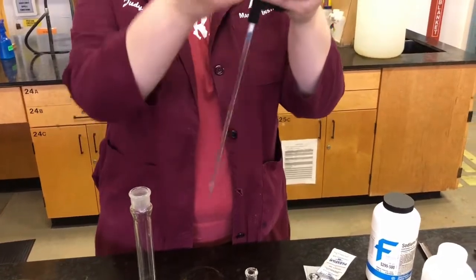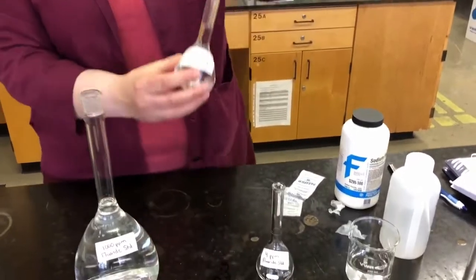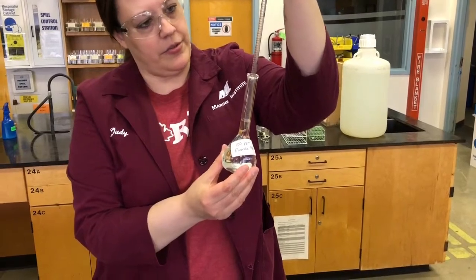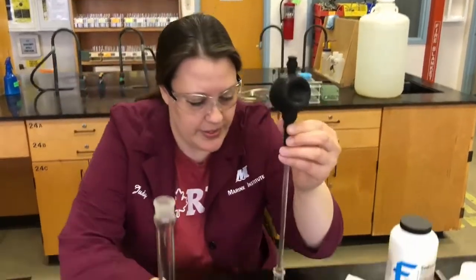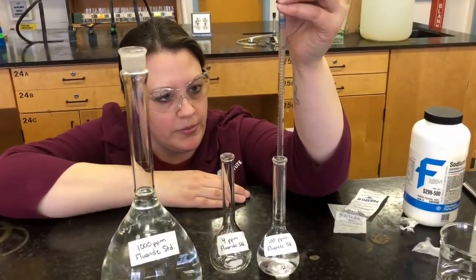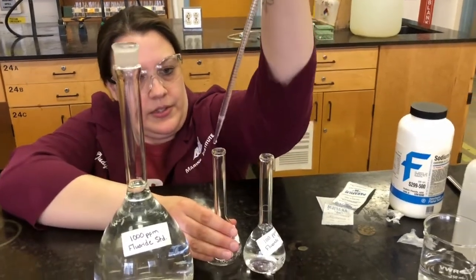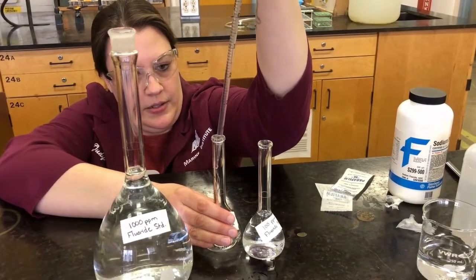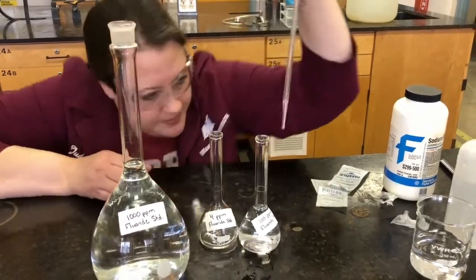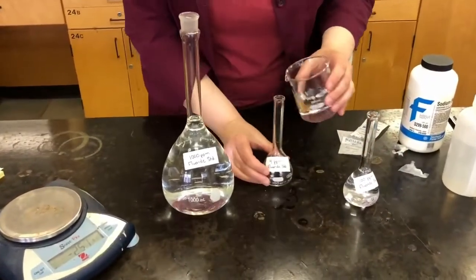Put those on. When you're putting these bulbs on, you don't want to have it too tight, so that it's hard to get off. But you want to make sure it's on there securely. So we're going to go up to 4. Again, I'm going to get at eye level with this. I'm going to get my other flask ready. So if we go up to 4, here we are. Put this into the other flask. And then we have our 4 mls in there. Again, I'm going to top this one up with water.